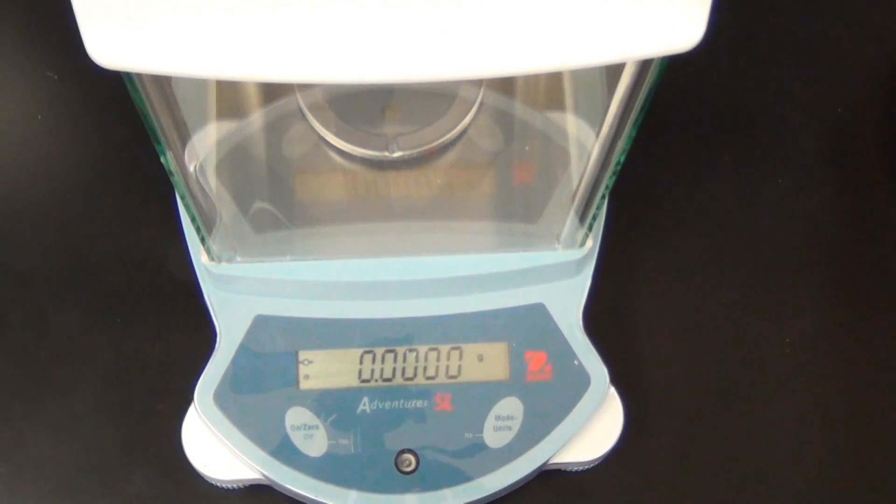I will not be using the scoopula, I will be using the micro spatula today. Also, as you watch this, look at how the equipment, the doors, the hands are being used to measure this very, very small amount.